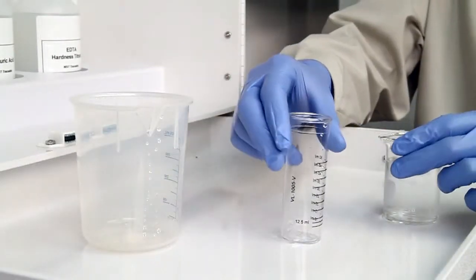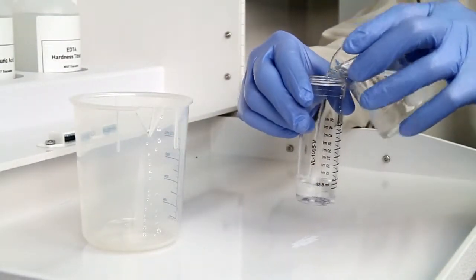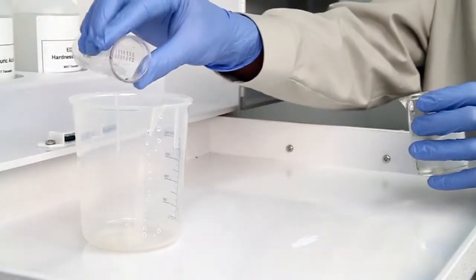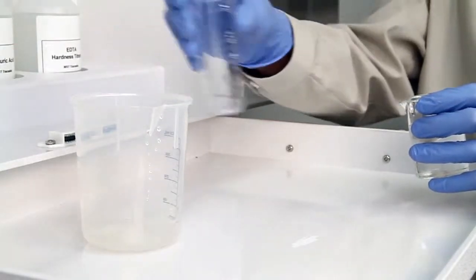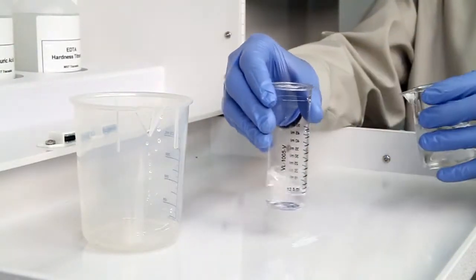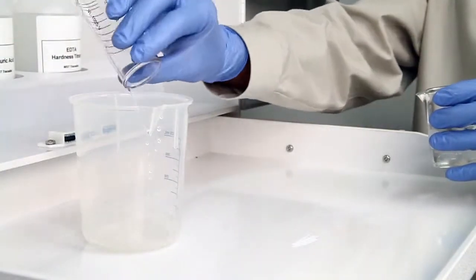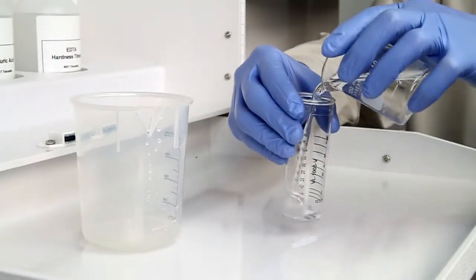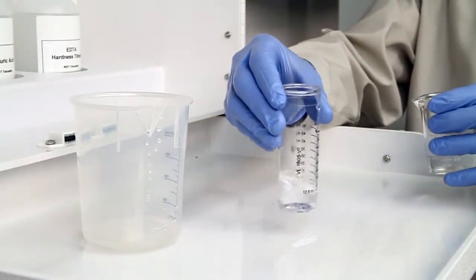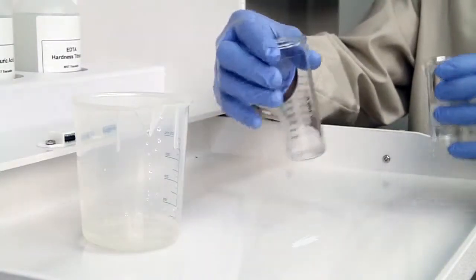The first step according to the Endpoint ID procedure is to collect an accurate sample. The smallest change in sample size will lead to inaccurate results. Before collecting your sample, it's important to rinse the vial three times with the sample to be tested. This minimizes the chance of contamination from a previous titration.